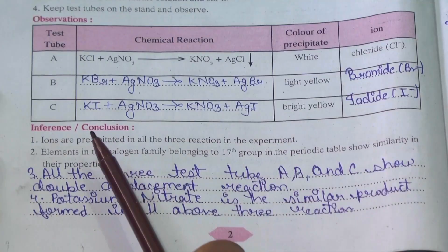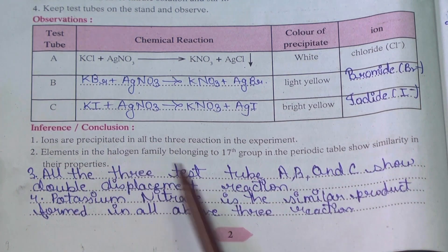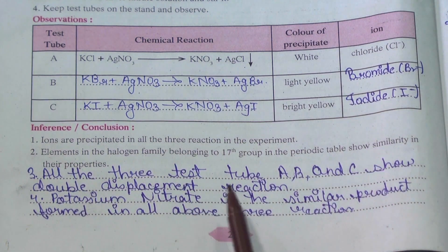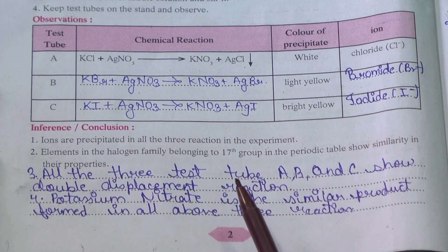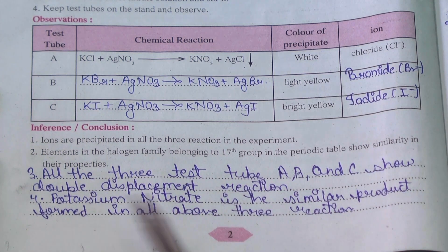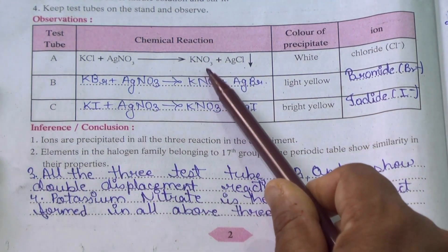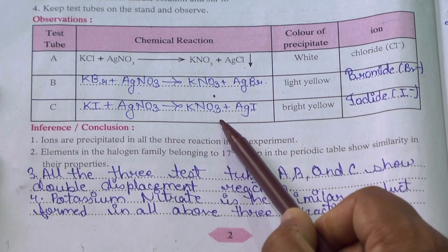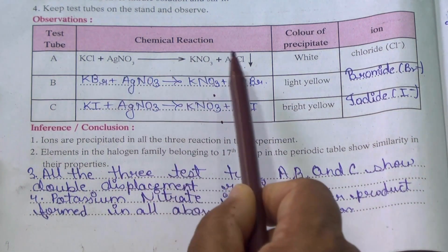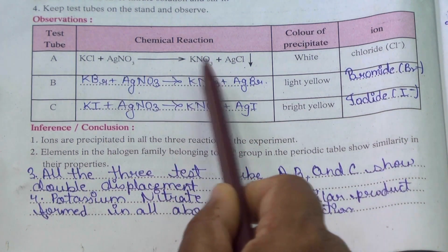Now we will go for the inference. We got ions that were precipitated in all three reactions. Elements in the halogen family belong to the 17th group in the periodic table and they show similarity in their properties. All three solutions A, B, and C showed double displacement reactions. Potassium nitrate (KNO3) is the similar product formed in all three reactions. Chloride moved with silver, and nitrate moved with potassium — so double displacement.